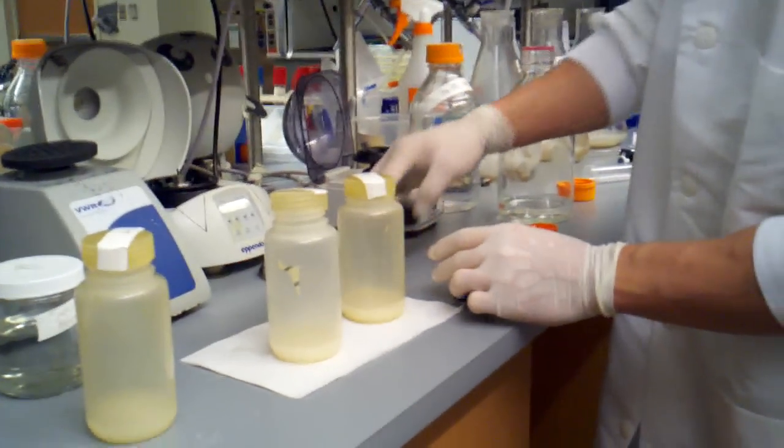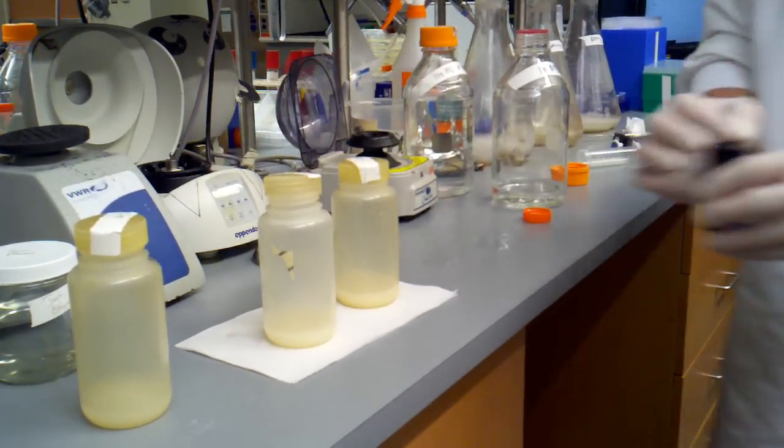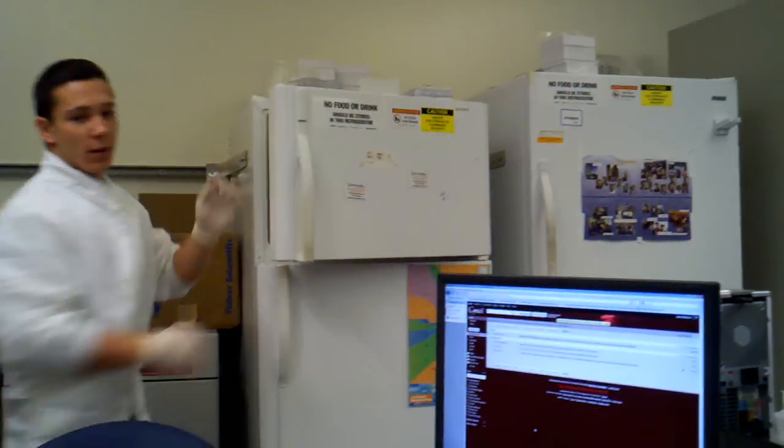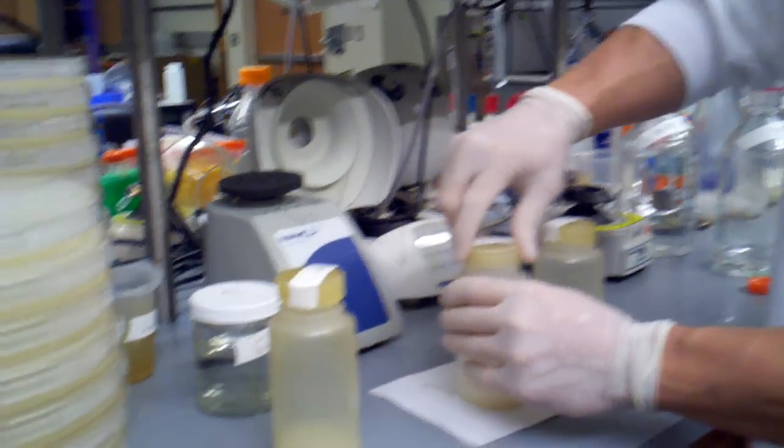A spoonful of lysozyme. So I'm just going to recap my lysozyme, and I'm going to put this back in the freezer where it belongs.